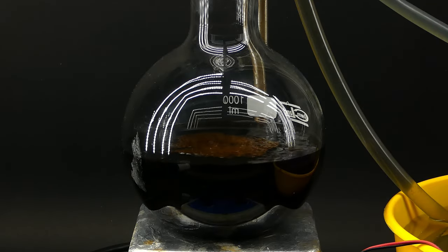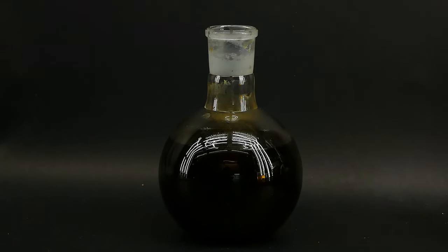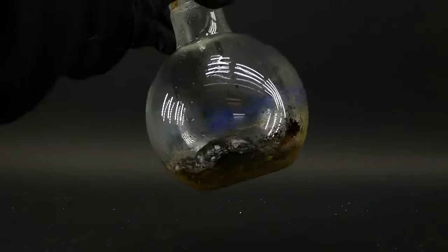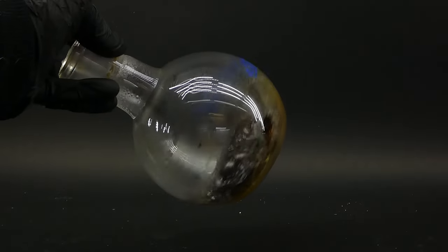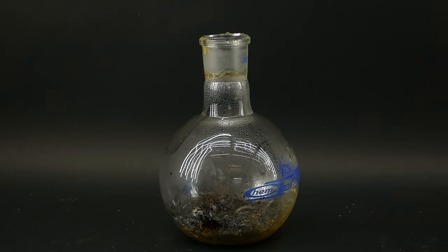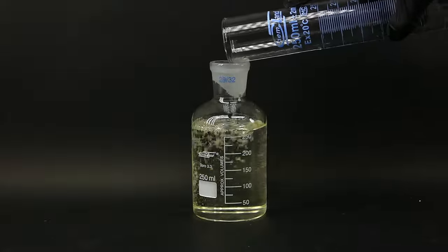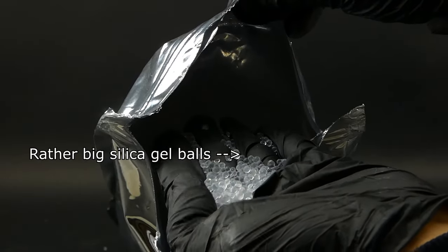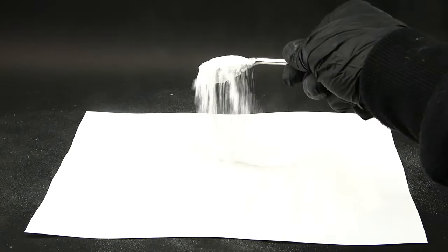I left this thing to run overnight, then filtered the still-hot mixture to remove a weird insoluble black substance, leaving me with a black solution of my cubane from which I quickly removed the solvent using distillation, ending up with this cubane tar. Now to purify it I have to carry out column chromatography — which I've never done before and I'm afraid I'll screw it up. To start, I prepared an eluent by mixing dichloromethane and methanol in a 95 to 5 ratio. The other component needed is fine silica gel; I only had it as rather big balls so I ground some using my old coffee grinder, which worked better than expected.